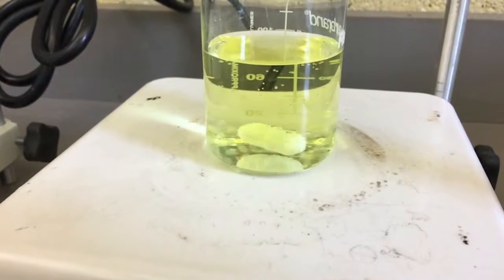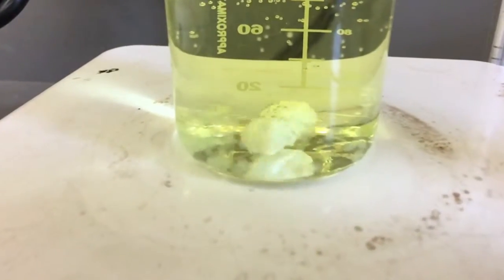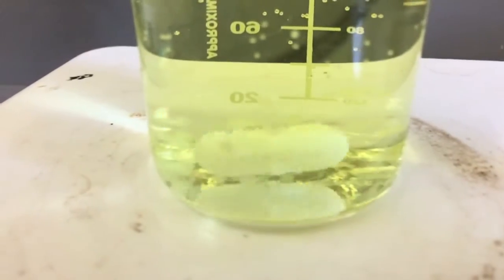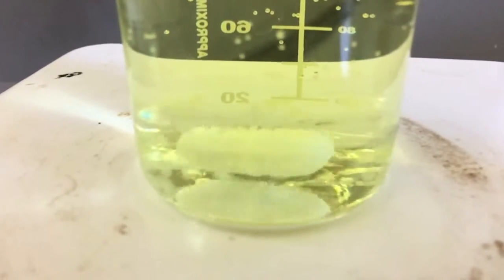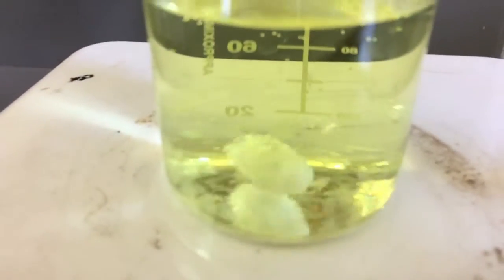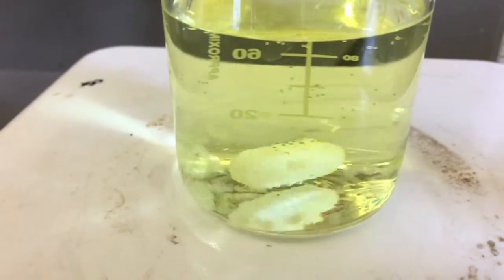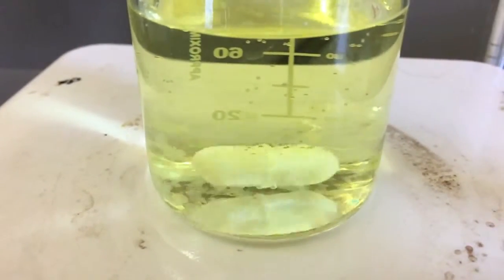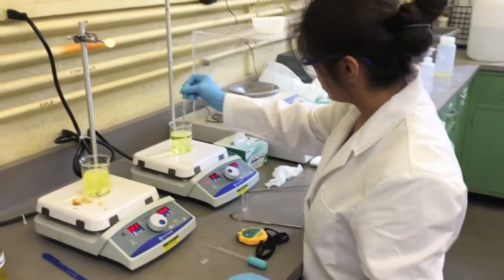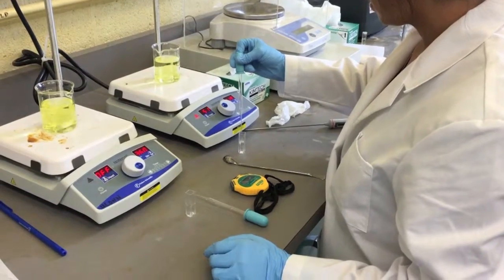In conclusion, we find that the final concentration of the tartrazine in the solution is only determined by the bead size. This makes sense because the larger beads contain more dye, so there is more dye in the solution when equilibrium is reached. It is also clear that factors such as mixing speed and temperature may have a significant effect on the release of this drug.